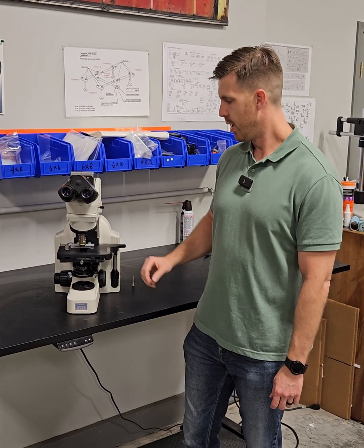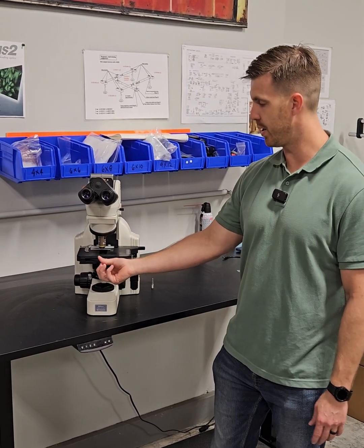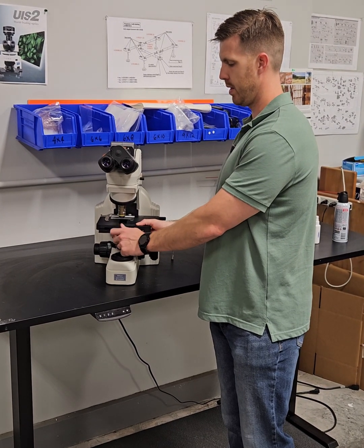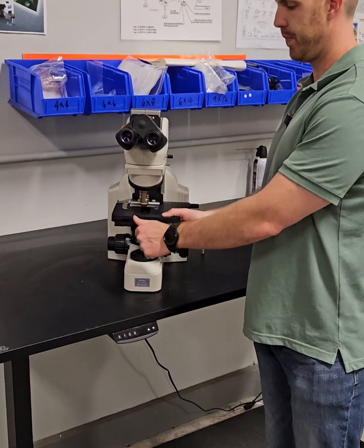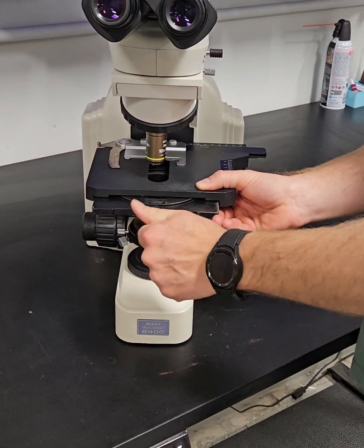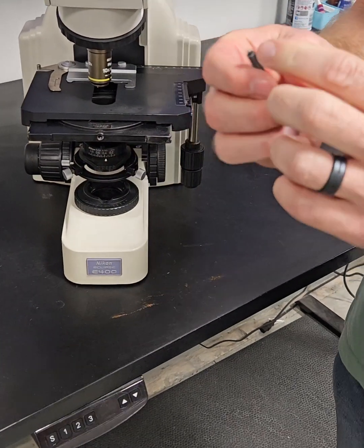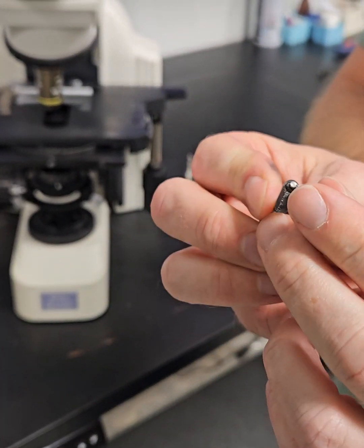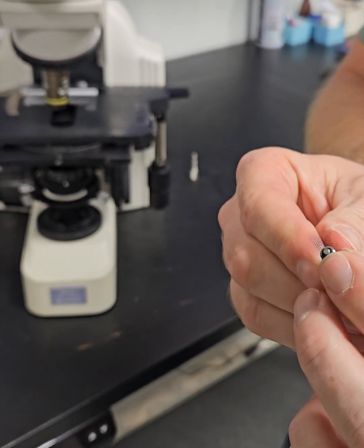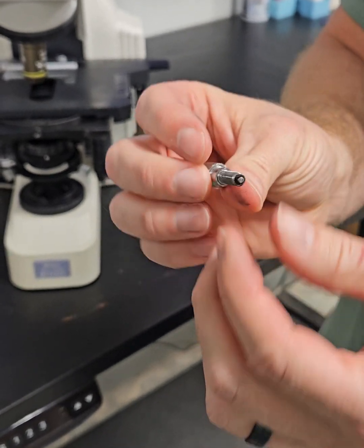Today we're going to talk about a problem on a lot of the Nikon scopes. So this screw right here has a plastic tip and is spring loaded. I'm going to back the screw out and show you. See, it had a plastic tip. See how this pin's showing? It is broken off. This plastic piece right here is very common and it breaks, it fails.